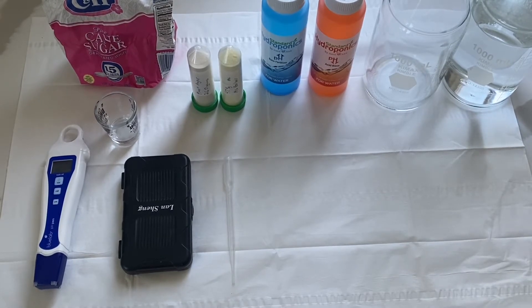These are all the ingredients we're going to need to make a basic tissue culture media. This is going to be a media that has no hormones — it's just meant for mostly popping seeds. A lot of plant species, including cactus, don't require hormones. It actually just requires the direction of the cutting you put — if it's upward or downward, that will regulate all the hormones. So if you're in an area where you can't buy plant hormones, that's not the only way to do it.